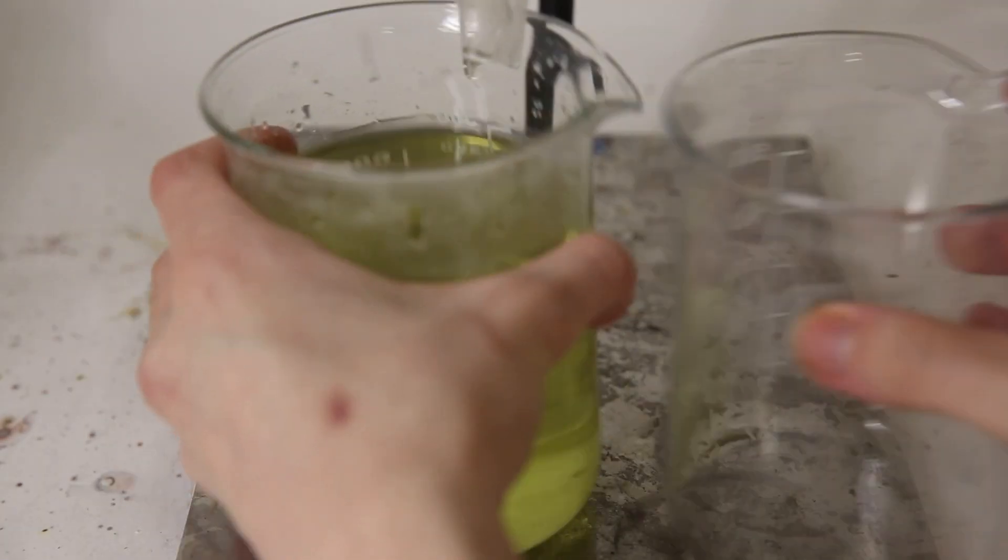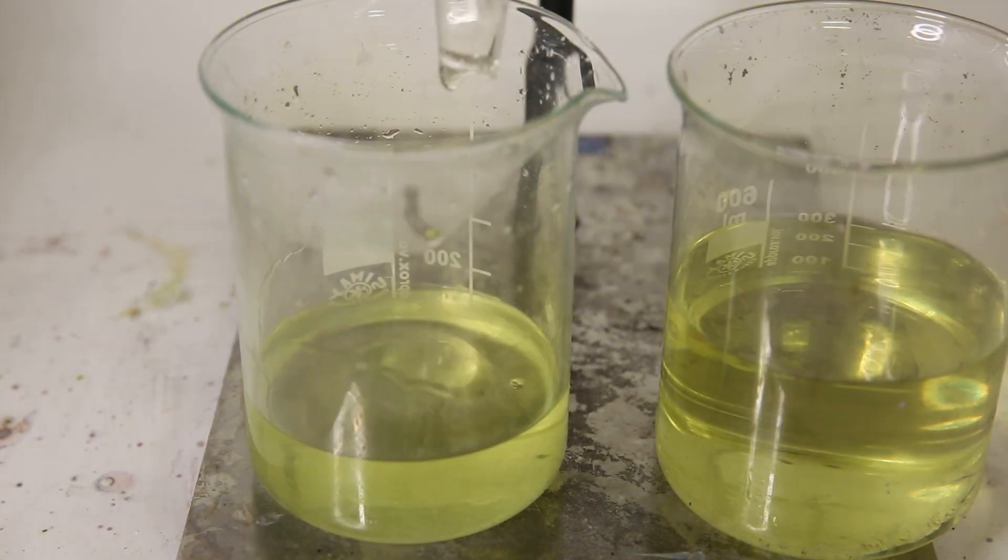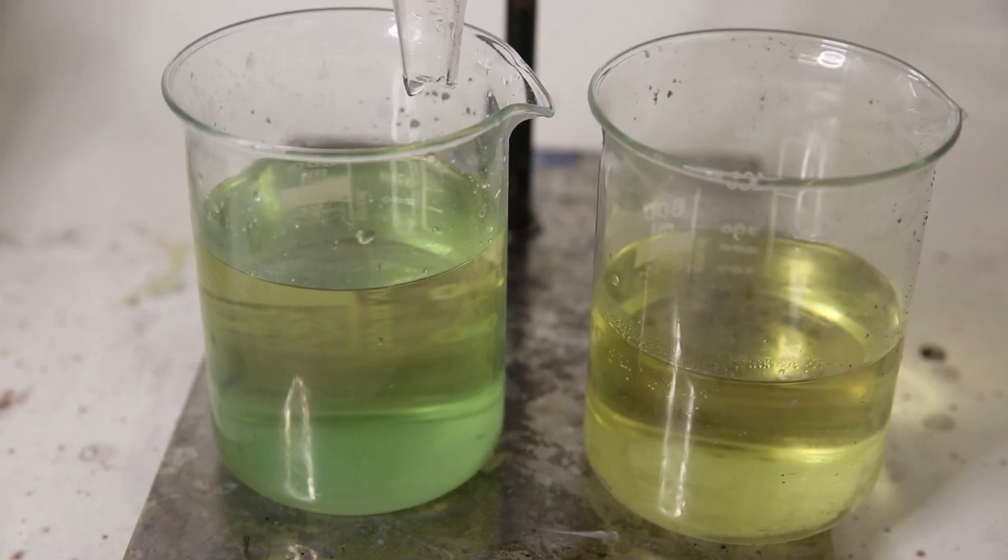So after a while of filtrating, I put the filtrate into two beakers since the volume was getting too much. After the filtration is finished, we are left with two solutions which apparently got a different color, but it's not really much of an issue.